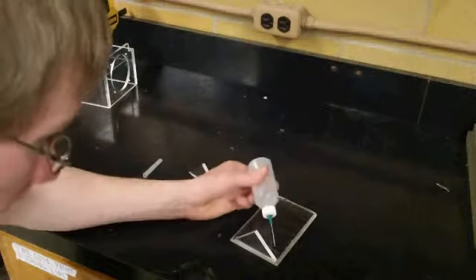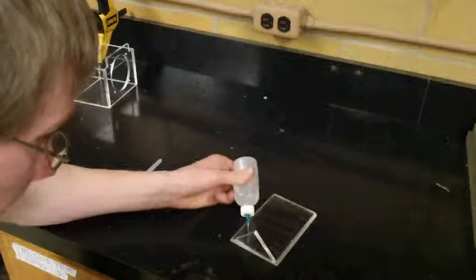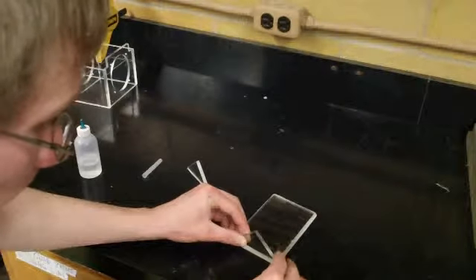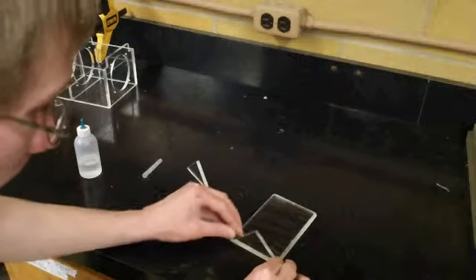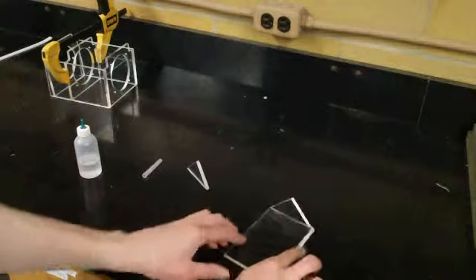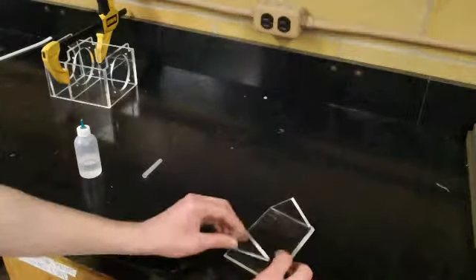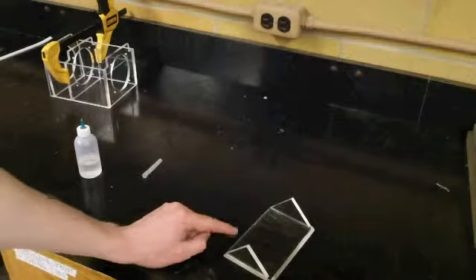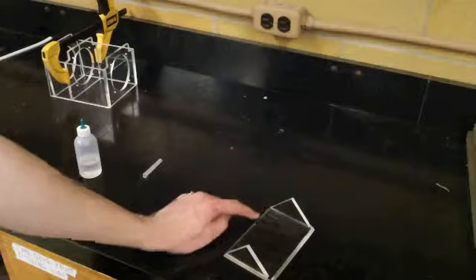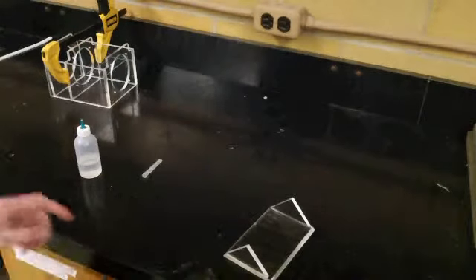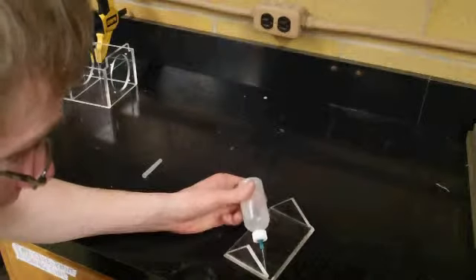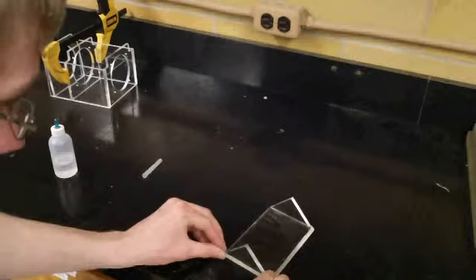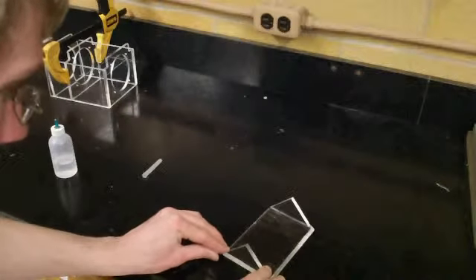Alright, and then just add the glue and let that side sit for a while. And then we'll do the same with the other side, taking care that we make sure to line up, flush this triangular piece up on the same side as we did with the last triangular piece. And then add the glue and let that sit.